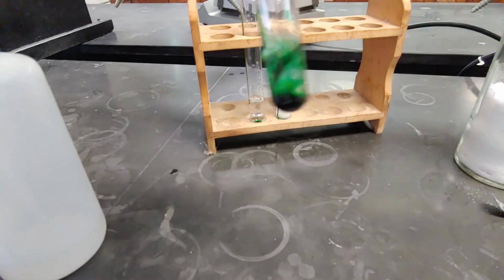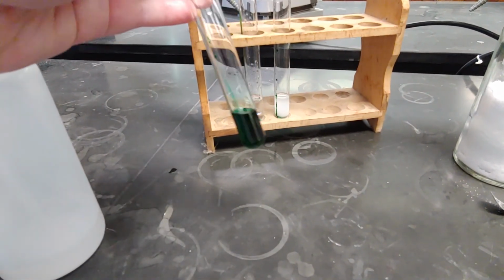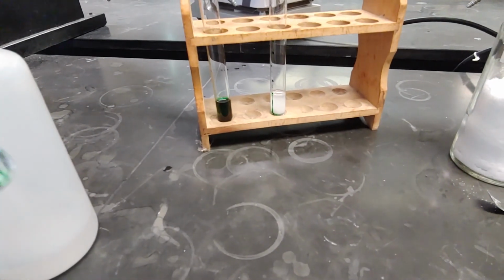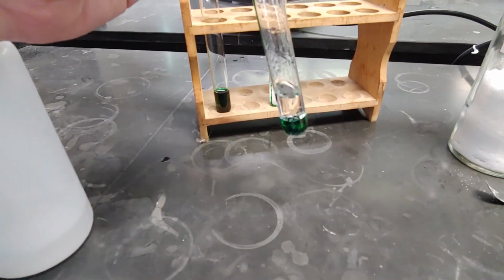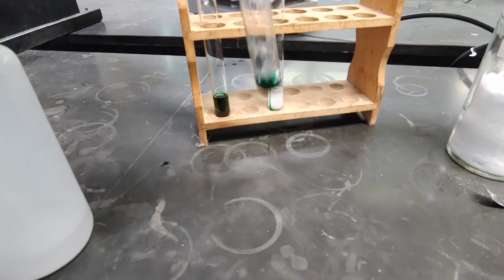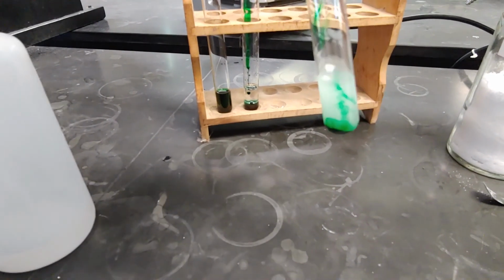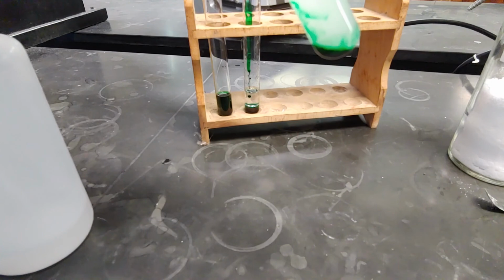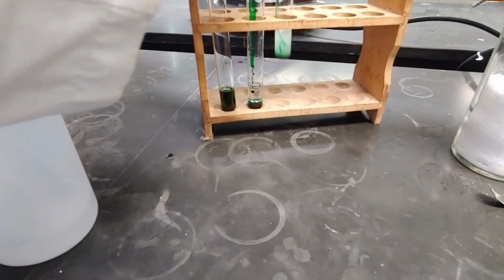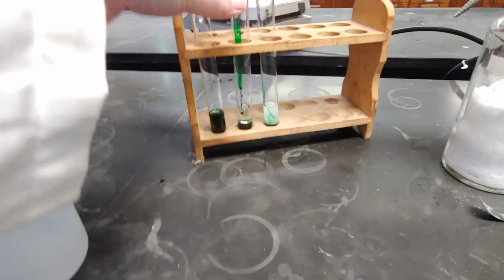Alright, so let's check it out. Alright, that looks pretty uniform to me. A lovely, nice, deep green. This one, you can actually see some bubbles of food coloring stuck in the toluene. They would not dissolve. And here, you can very clearly see that there's a nice dark green bubble at the bottom. But the solution isn't mixed 50-50, so it's not quite an even split like this guy.